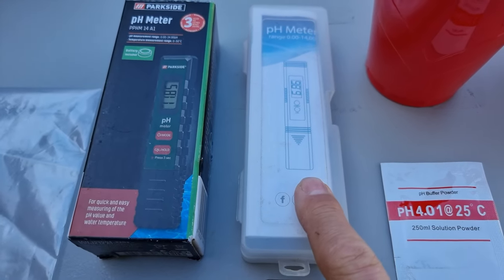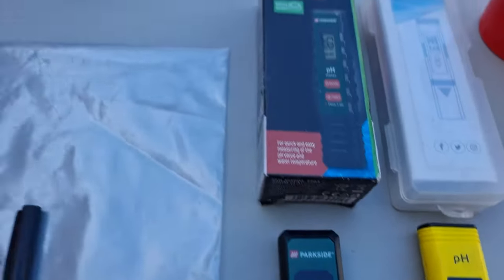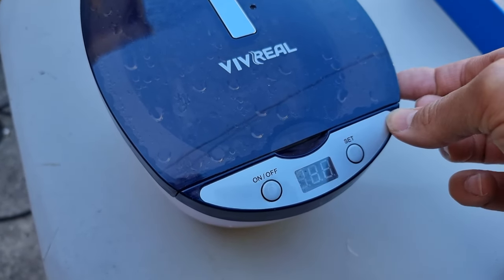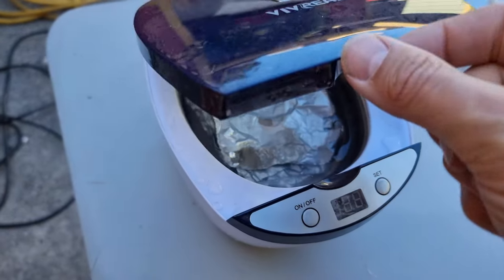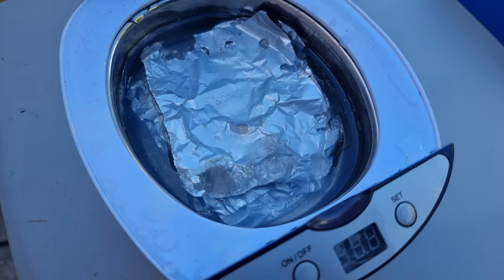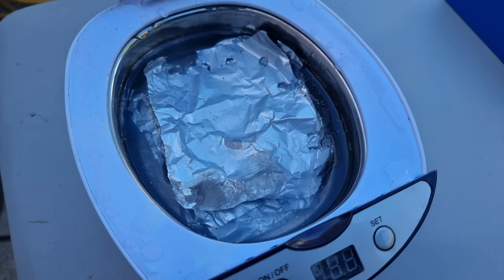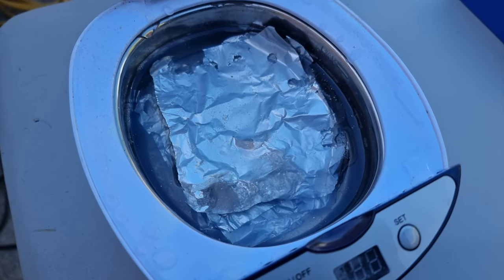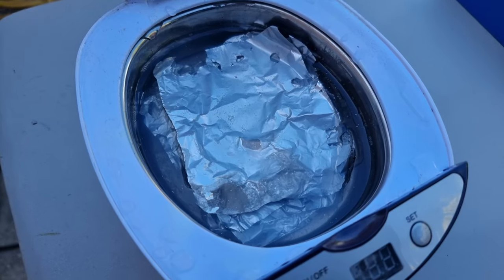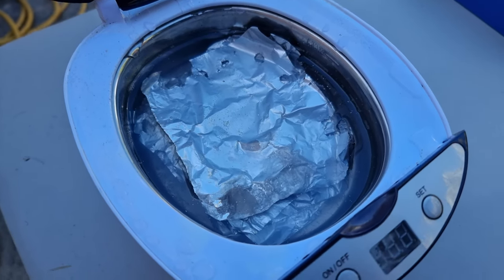We've got a new one and this is Alan's previous one, and we're going to calibrate these two. The reason we're doing that is because of the experiment we conducted with large numbers of sheets — in fact seven sheets of aluminium foil. We're going to see what the pH of this water is, because it would appear that we observed hydrogen coming out of there at least yesterday. We want to see if that has changed the acidity or alkalinity of the water. I suspect it's going to be alkaline if we're going to have more OH in there.